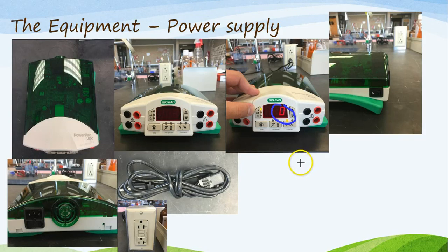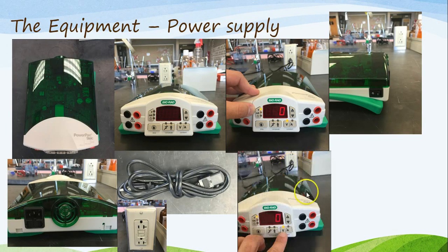Other things you should see is you should see that the voltage, or V, is lit up right here. And you should also see that the V for voltage is lit up down here. If they aren't both lit up, please come see your teacher.